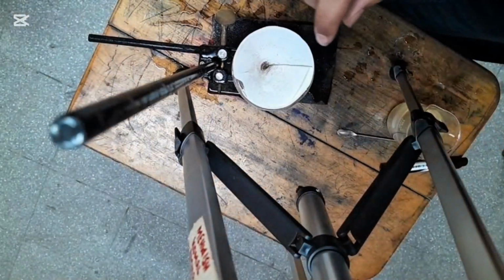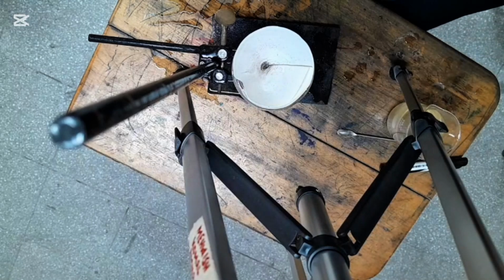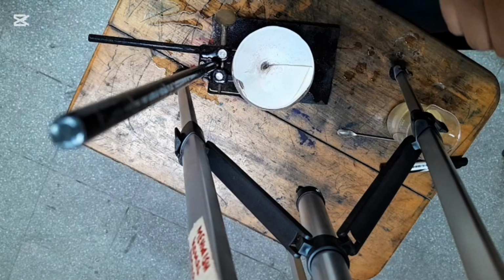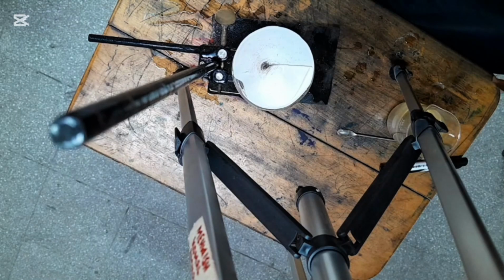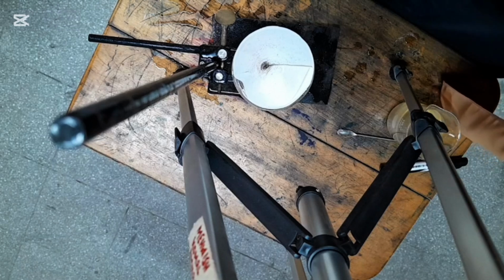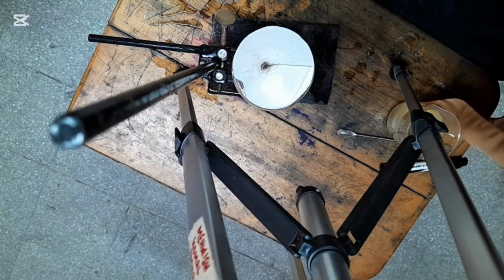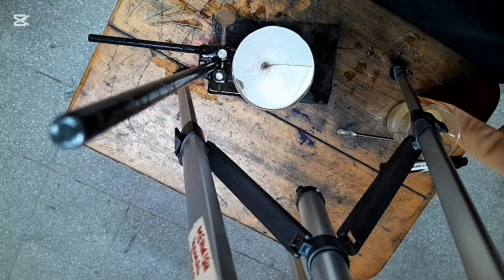So from this it is proved that a suspension is not a true solution. Okay, a suspension is not a true solution. The particles of the suspension are not getting mixed with the solvent completely. When we leave it for some time, we can see that the particles of the suspension settle down in the beaker, and when we filter it, they are left on the filter paper after the filtration process, and we can see them as a residue.